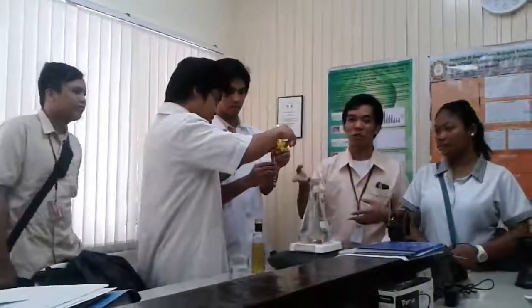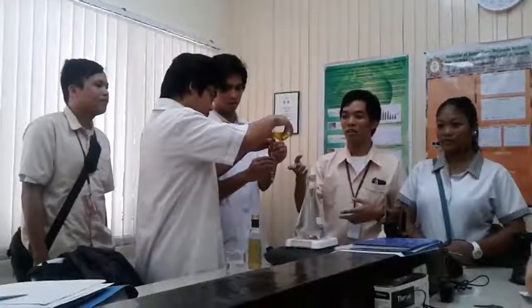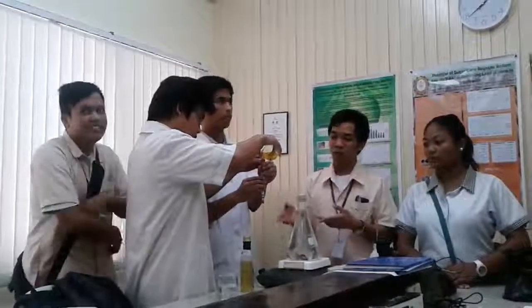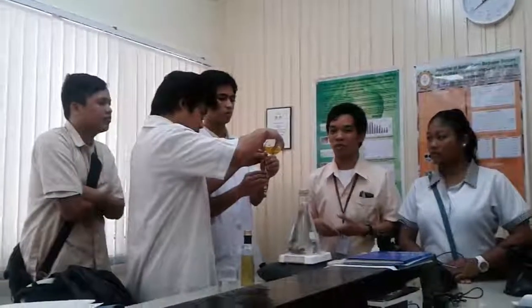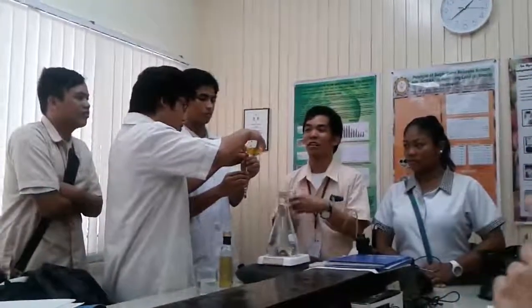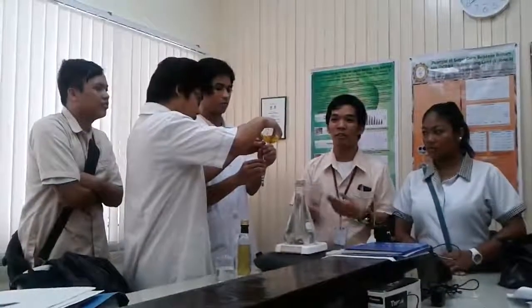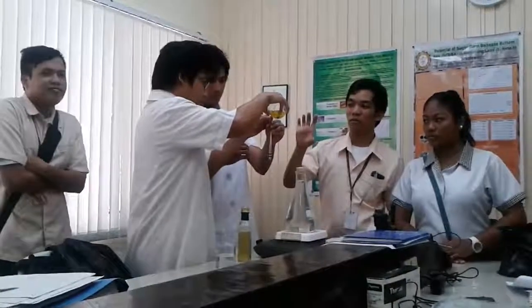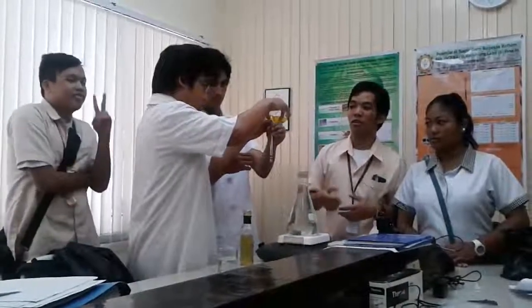So first, we're going to pour the oil into the tube, and what you have to be careful with is that there must be no bubbles inside the tube. If there are bubbles, then you have to repeat this step again and again, or you can heat it to relieve the air bubbles. And then you must also fill the tube to the brim so that you can achieve the terminal velocity right away.